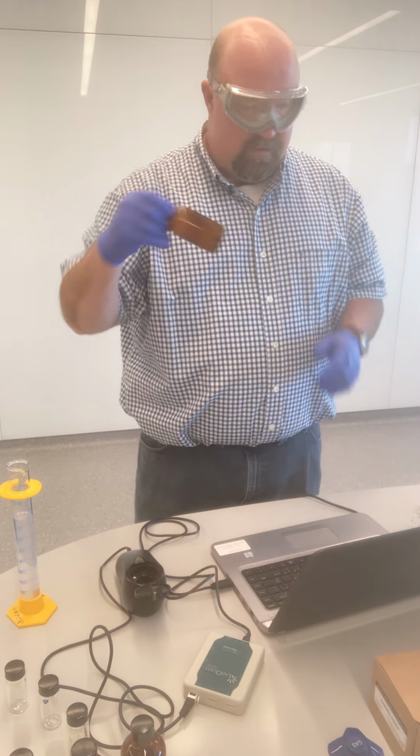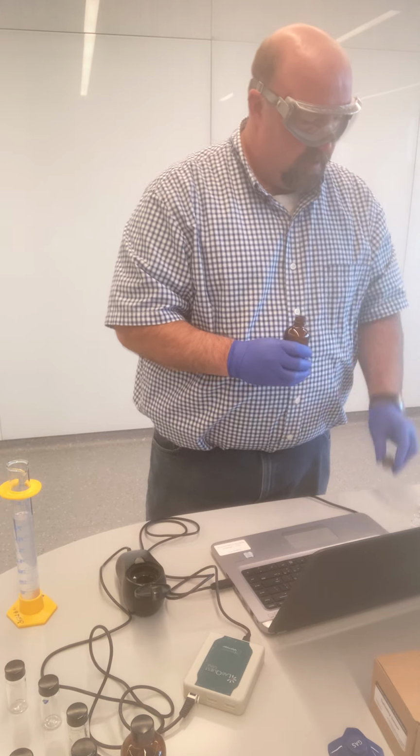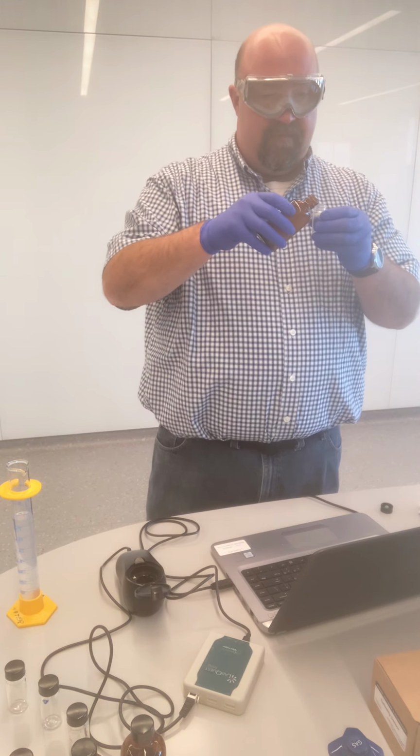And so now, last but not least, we'll move on to sample 5.